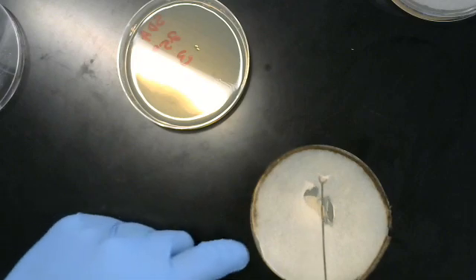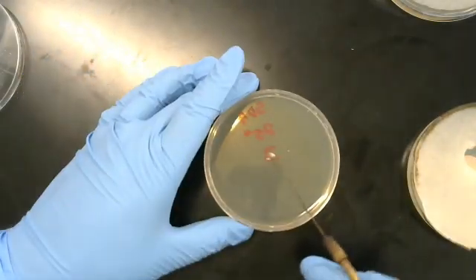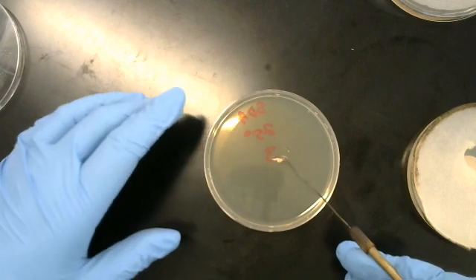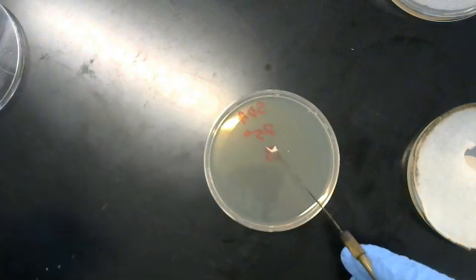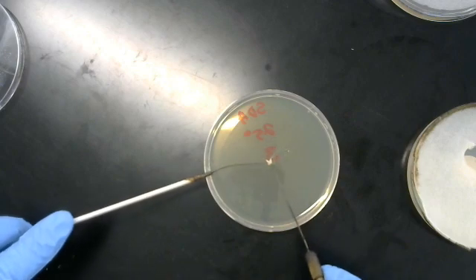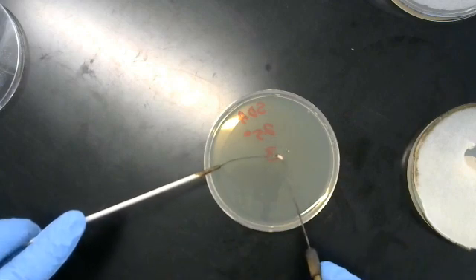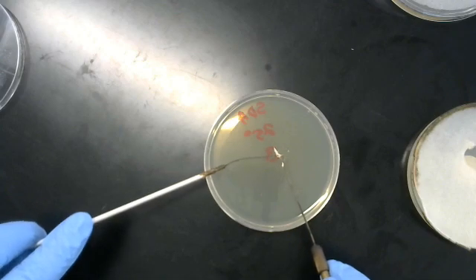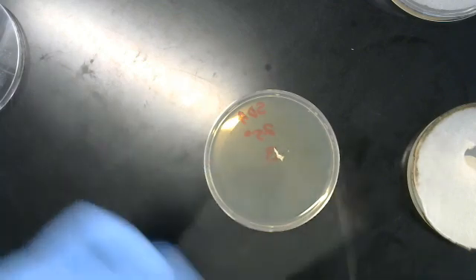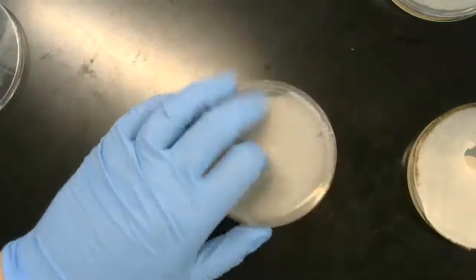There we go. That section right there, place it right in the center of the SDA plate. Once again, I need to use a needle to anchor it. Like that. Put it on.